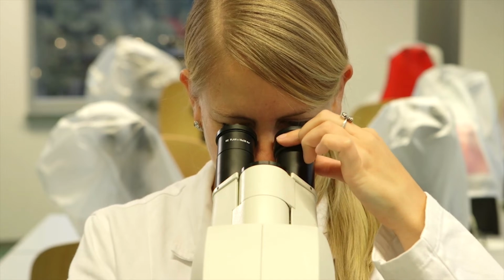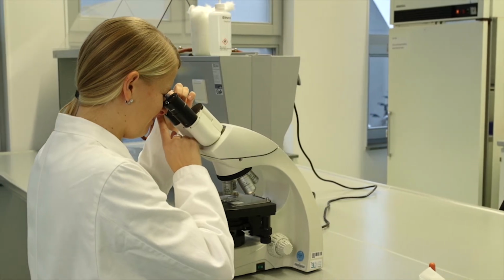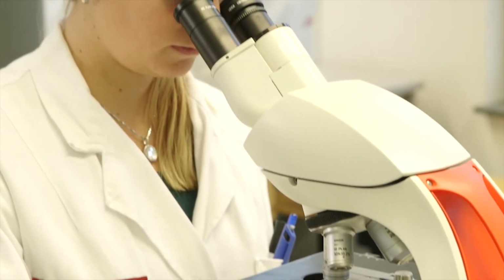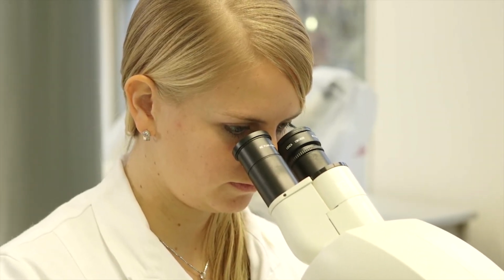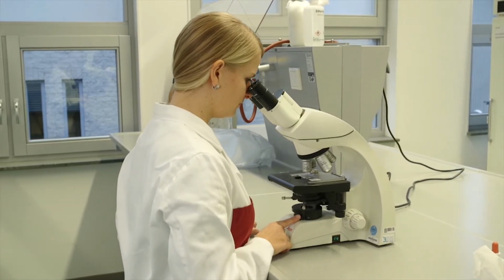image comes into focus. Each ocular lens is individually adjustable in terms of sharpness. If necessary, you can adjust this by turning the diopter adjustment ring. If there are 2 oculars with a diopter ring, then put them both at the 0 setting. Adjust the focus for the right eye with the micro adjustment knob. The left eye is then adjusted using the diopter adjustment ring.